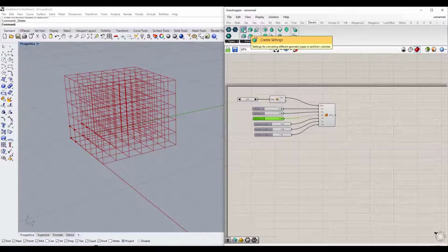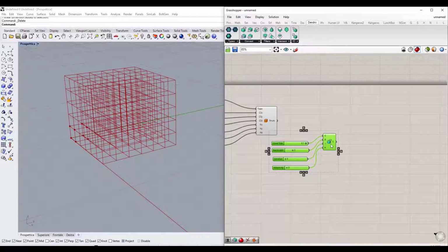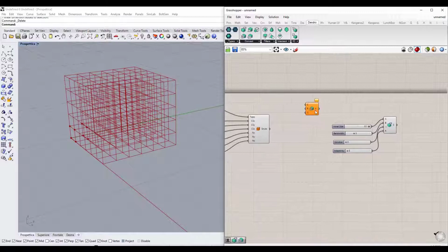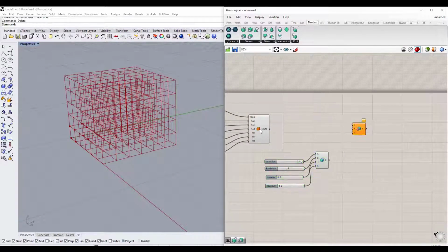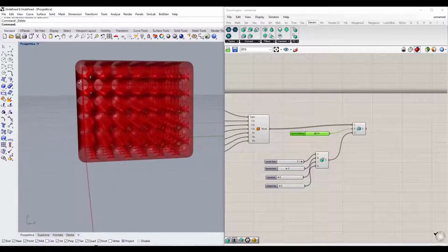To do this, we click on Dendro Components, then click on Create Settings Voxel, drag it to the screen and set these specific values as you see them on the screen: 0.1 for voxel size, 3 for bandwidth, 0 for ISO value, and 0 for adaptivity. Then we click on Curves Volume and drag it to the main window. Now we connect the wireframe structure under Curves and the Create Settings under the Settings item, and we set a radius for our rods such as 0.4 millimeters, for example.